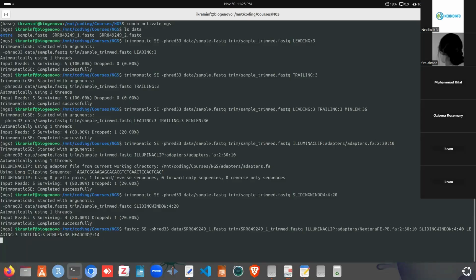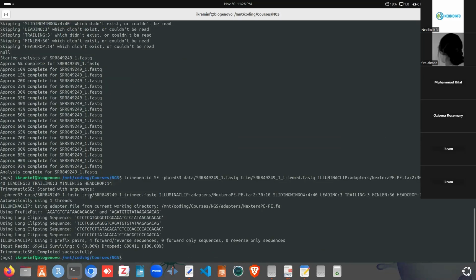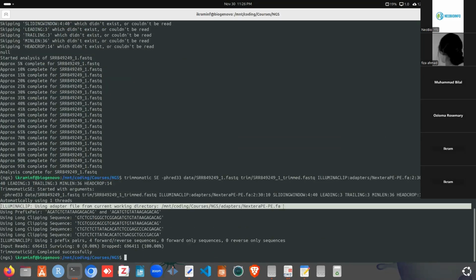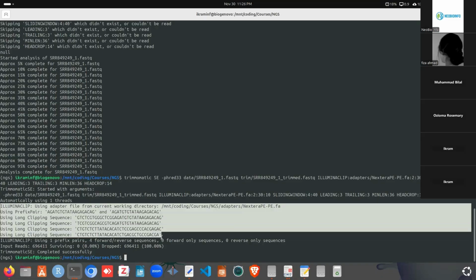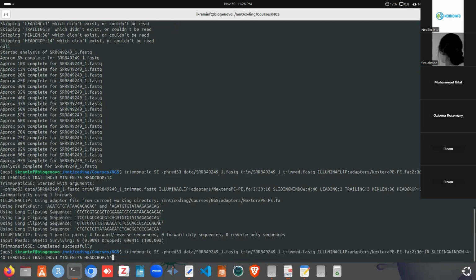So if we run this now, okay, I made a mistake. The tool name should be Trimmomatic, not FastQC. Here we can see the output. It read the adapter file first, and it found these adapter sequences in the file, and after that it said how many survived and how many were dropped. Here this means it removed all the bases. We need to specify the parameters again. We can remove this for now, we will use that later.